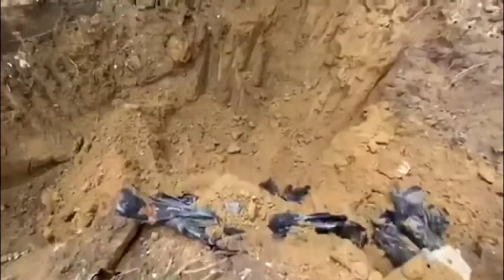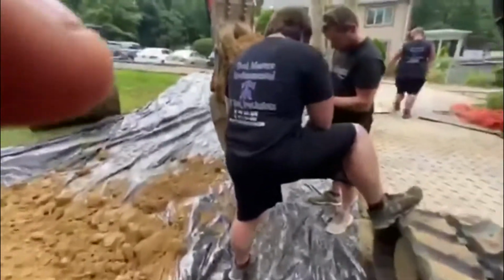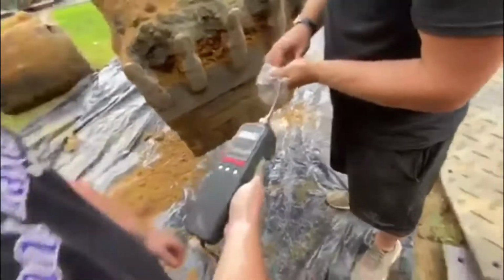So we just took our scoop right here, as close as we want to go to the foundation. The tank grave was over here, but we took a scoop at the bottom. We got some gray, which you know is the contaminated soil. You see the gray all the bottom of there. So now we're doing a PID reading.